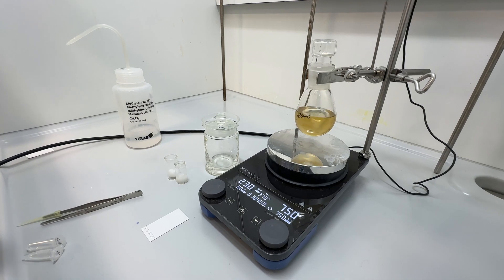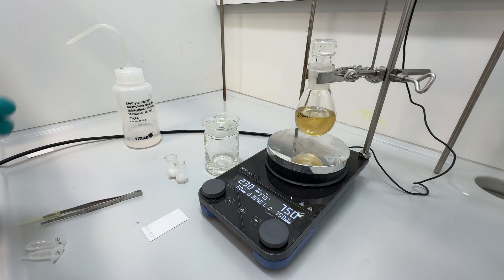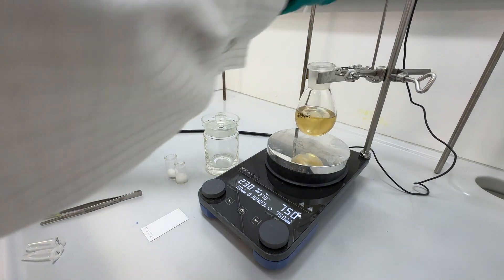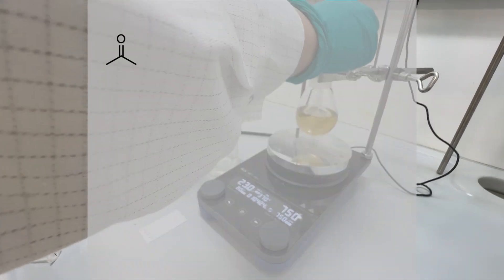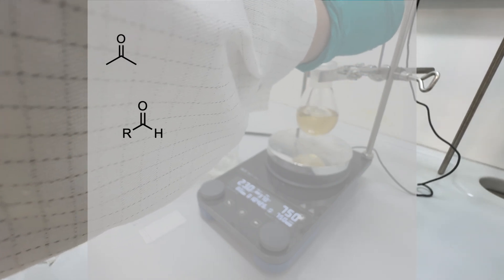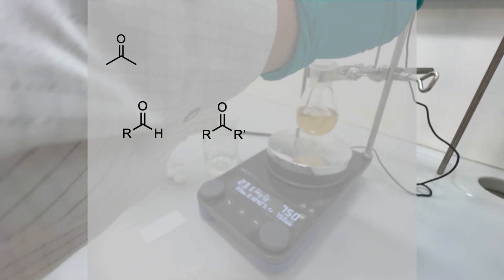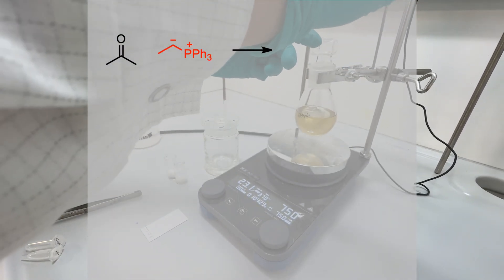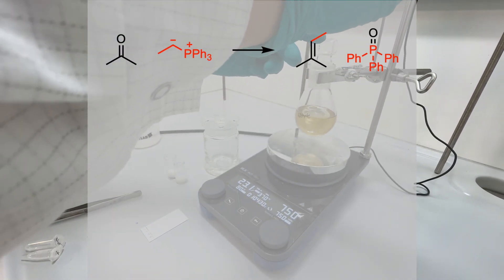I set up a Wittig reaction. The Wittig reaction involves the reaction between carbonyl compounds, such as aldehydes or ketones, and phosphorus ylides to form carbon-carbon double bonds.